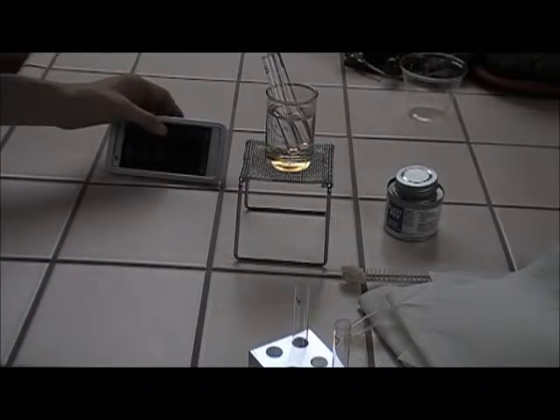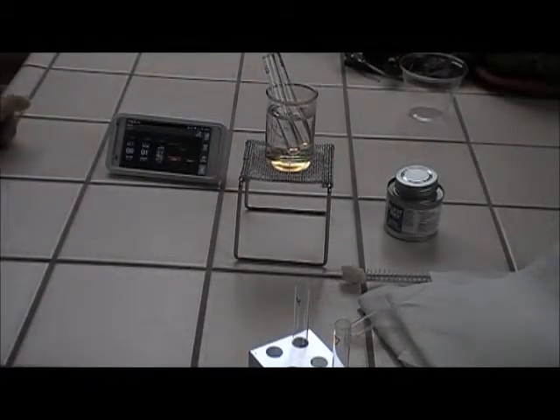Alright, so we're about a minute and 40 seconds in, and I'm about 2 feet or so away from the test tubes, and I have already started to smell a pineapple-y kind of banana fragrance come from them. So I am assuming that that is the fragrance for these two, for the ethanol and butyric acid, and the isoamyl and the butyric acid, which is quite interesting because I did not think that that smell was going to come from butyric acid that stinks so badly, like rotten eggs and butter. So we have about 53 seconds left, and I will be placing hot water from the beaker into the 2 test tubes.